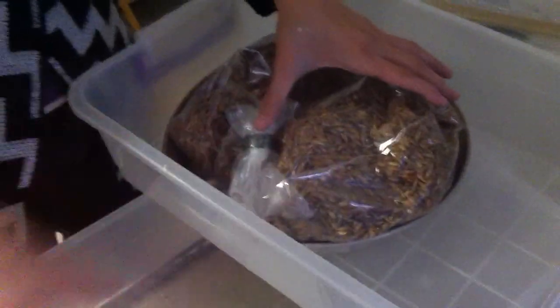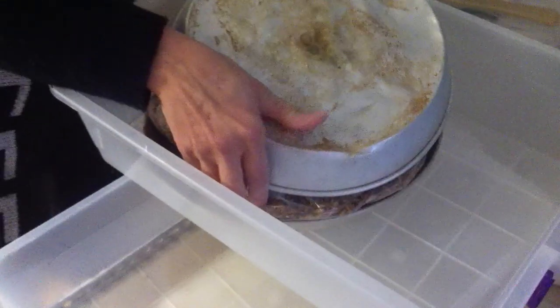So now this is the new system to fit in the pressure cooker. Just lie them two by two with between two aluminium dishes. Then we pile them up.